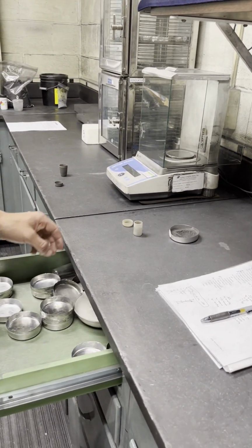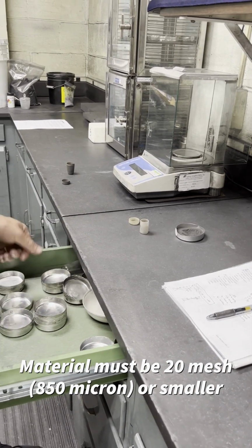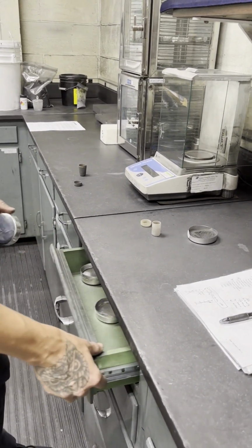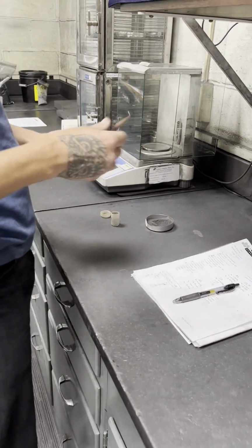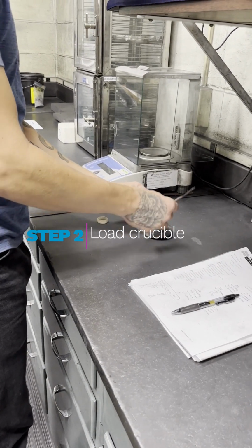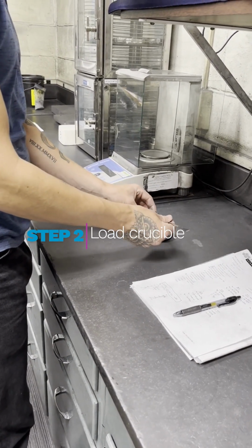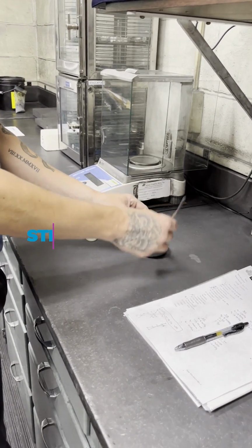You want to make sure the material isn't too coarse so it could fit in the crucible. If it's too coarse, you're going to have to grind it in the grinder. We're going to add enough material so that it almost fills the crucible. You want about 1/4 inch or 1/2 centimeter filled from the top.